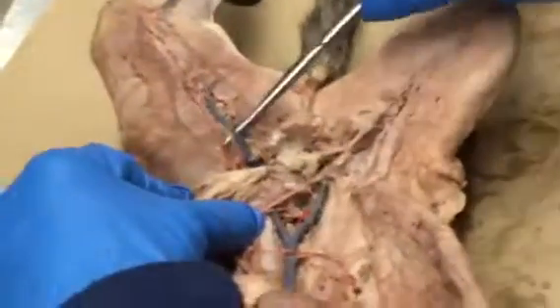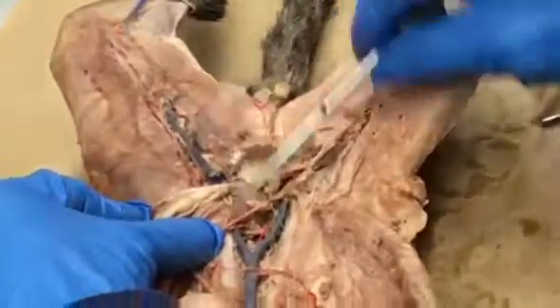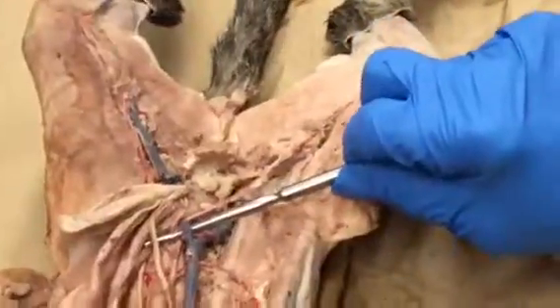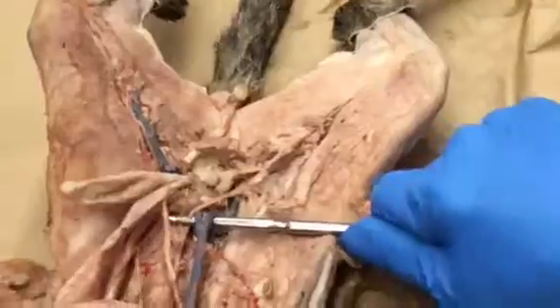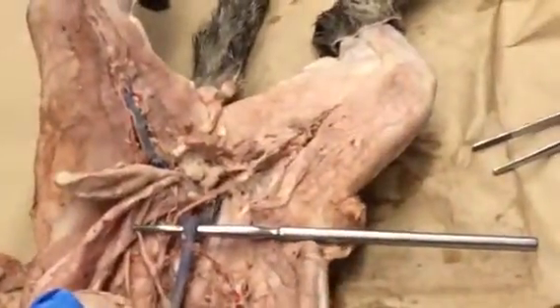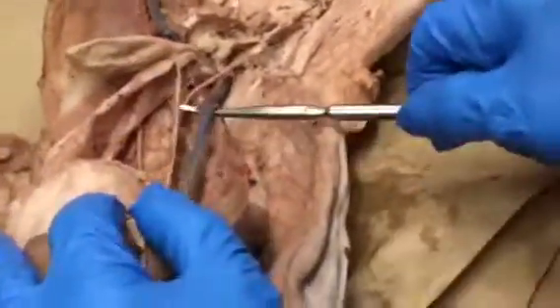Now, we're just going to follow the veins that carry deoxygenated blood back up to the heart. So I'm just going to move the organs this way so we can see this better. That's where we left off on the femoral artery, so it makes sense that this would be the femoral vein. Follow that up. Here's your left external iliac vein. Here's your right external iliac vein. They're going to meet in the middle there at the common iliac vein. Following this vessel right up the center of the body, this is the inferior vena cava.